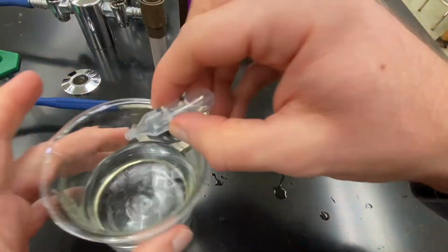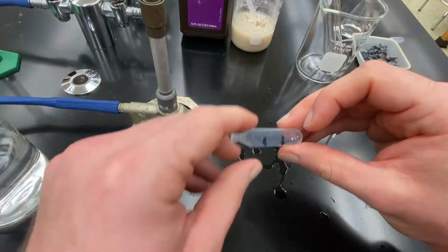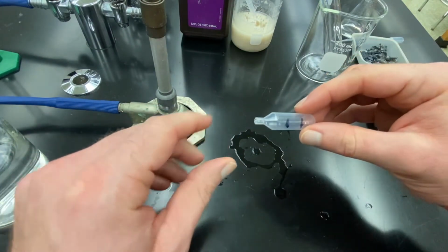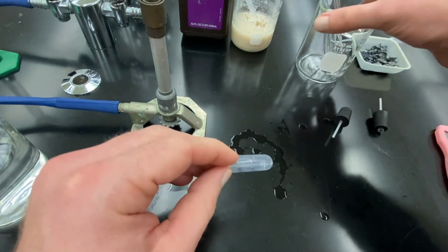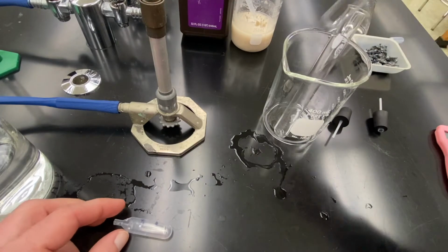I could then squeeze out the water. So now I can collect gases in here, hydrogen and oxygen. I could see the optimal ratio for combining the gases and causing the combustion reaction. So the next thing I want to do is create 2 gas generators. One is going to create oxygen.